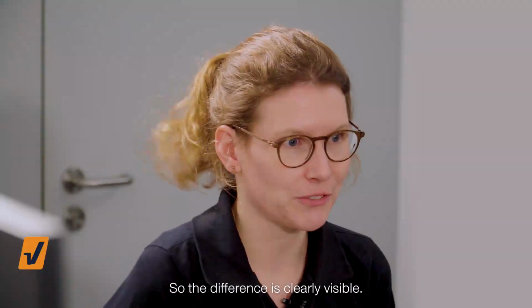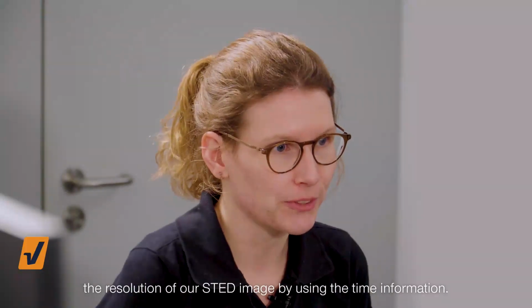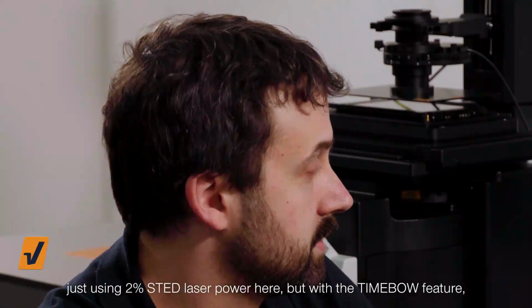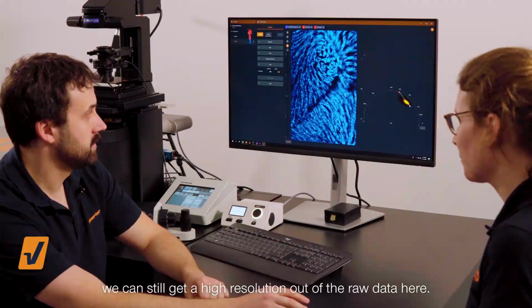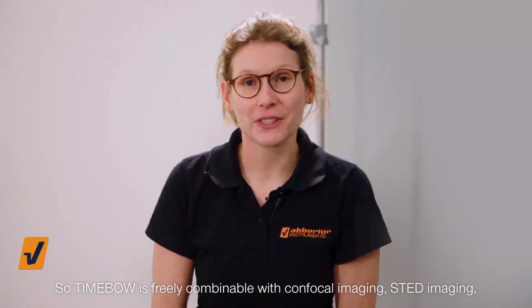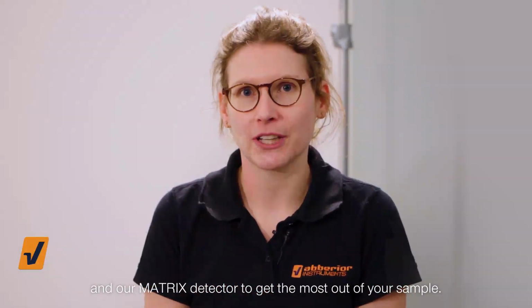Yes, nice. So the difference is clearly visible, and TIMEBOW helps us to improve the resolution of our STED image by using the time information. Yes, and what I find surprising is that we're just using 2% STED laser power here, but with the TIMEBOW feature we can still get a high resolution out of the raw data here. So TIMEBOW is freely combinable with confocal imaging, STED imaging, and our matrix detector to get the most out of your sample.